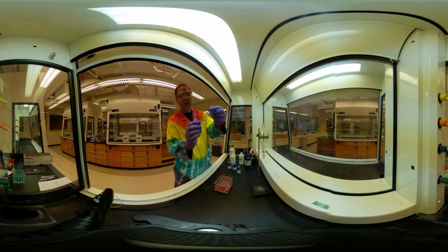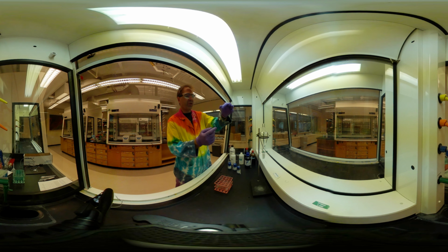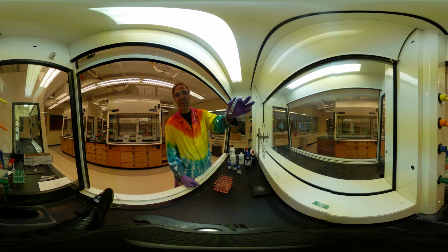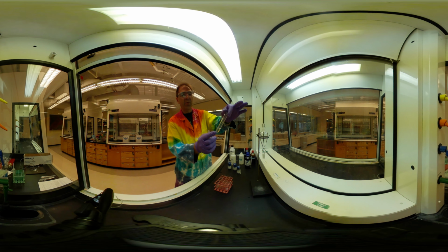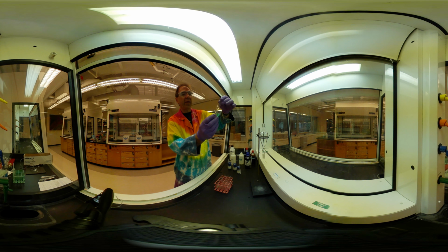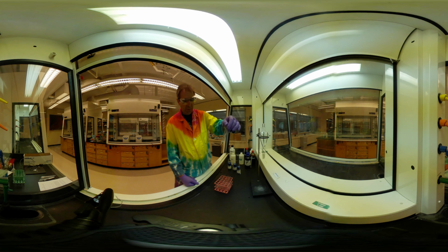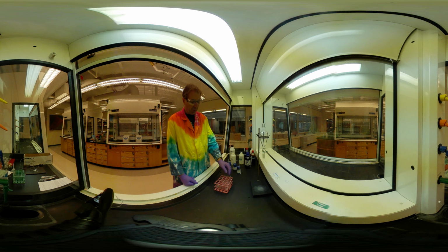So in water, you can hopefully see there's a lot still floating in here. A lot in the crystals, insoluble. Next one to look at is with the hydrochloric acid, and everything has dissolved. So soluble for the hydrochloric acid. The sodium hydroxide, oh, definitely not soluble. You can see a bunch on the sides here, some floating in there. And then the dichloromethane, soluble. Okay, so we had soluble in the HCl and the dichloromethane.